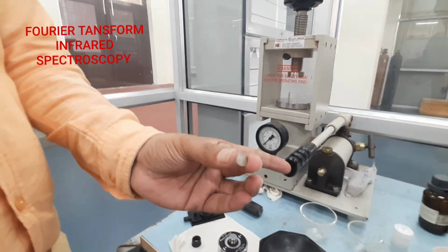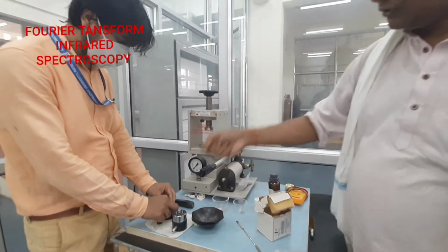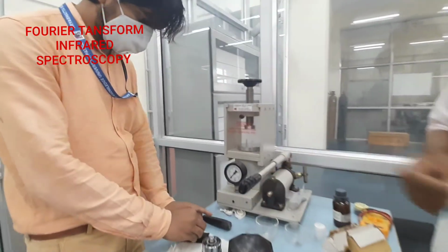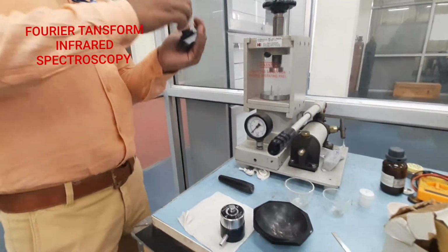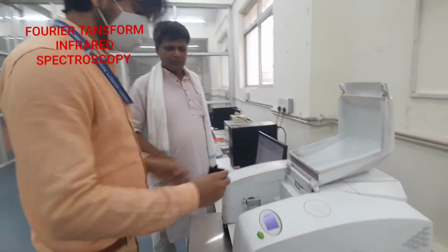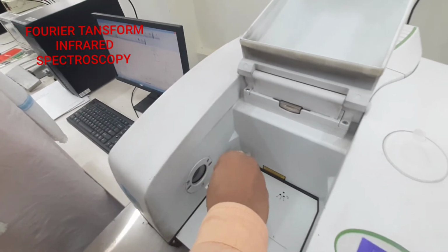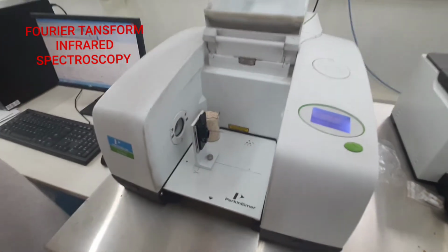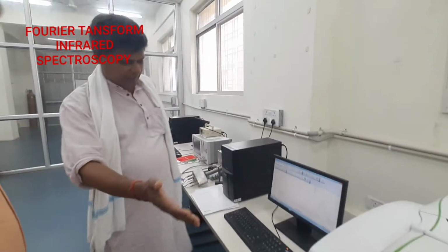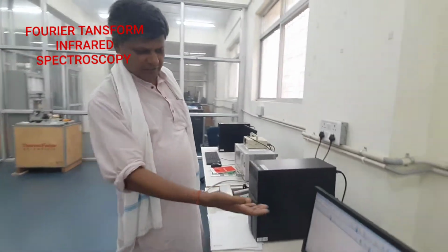This pellet is formed by mixing the semiconductor material with KBr, and finally you put it in this device and apply some mechanical pressure, and finally we get it. Now this sample is put in the FTIR equipment. This is a Fourier transform infrared spectroscopy, and you put the sample in this equipment, and IR radiation is passed through the sample, and we get the spectrum of this IR radiation on this screen.